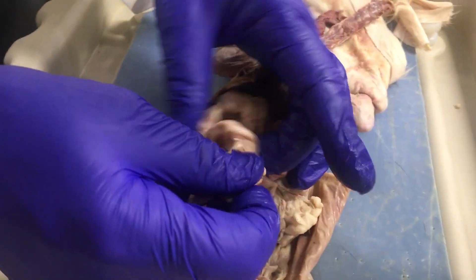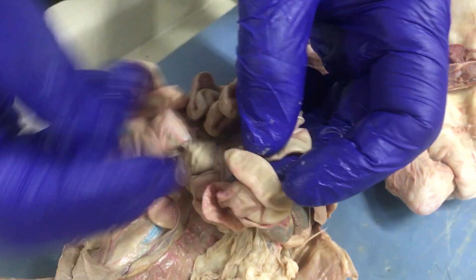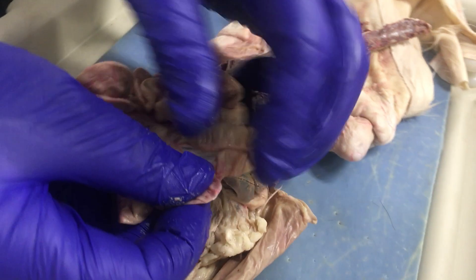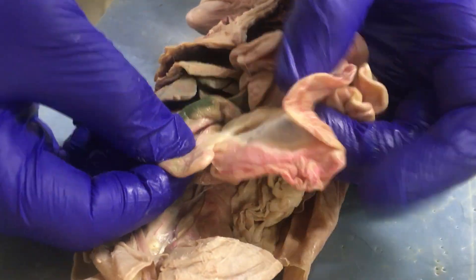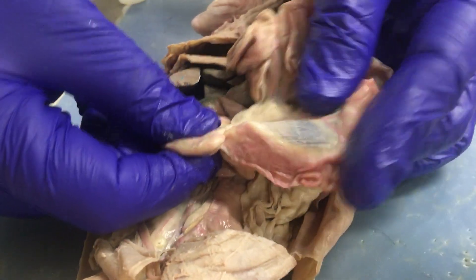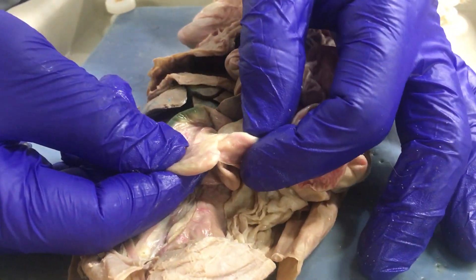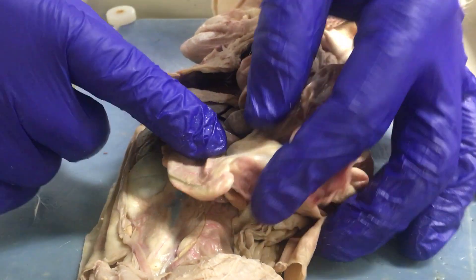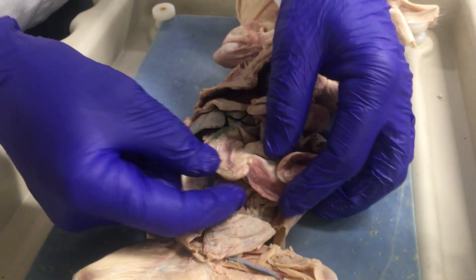This is the jejunum, and then partway along here it changes into what we call the ileum. I can't tell for sure exactly where that changes, but if you keep following it you finally end right here where the small intestine joins the large intestine — this would be the ileum.